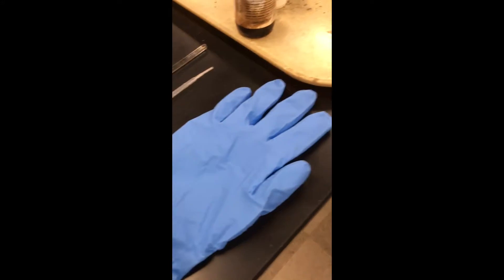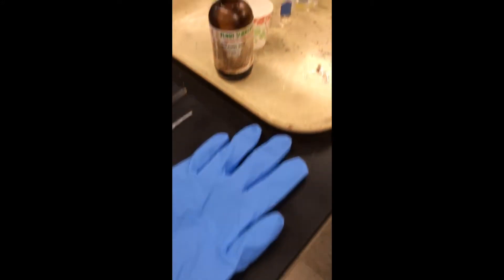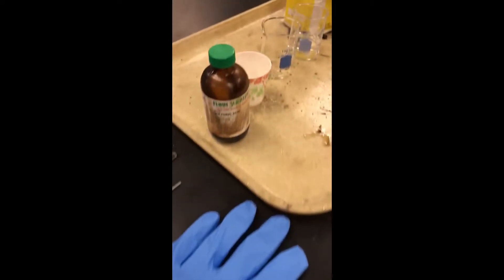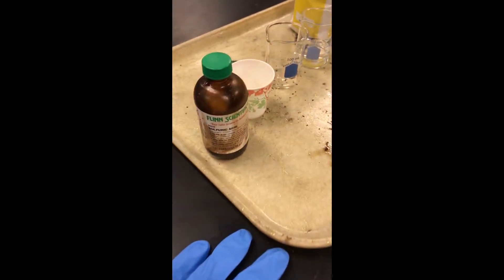We're also going to need gloves to protect our hands since we are using sulfuric acid. And we're also going to need an 18 molar solution of sulfuric acid to pour into the sugar.